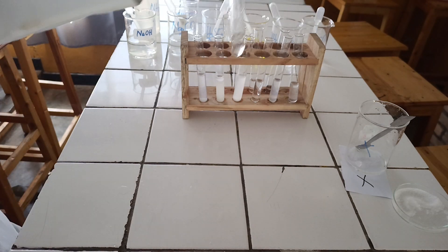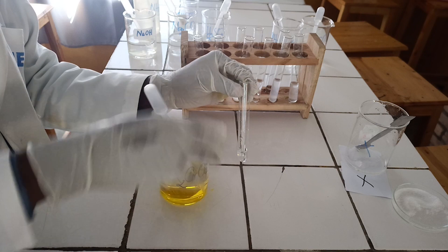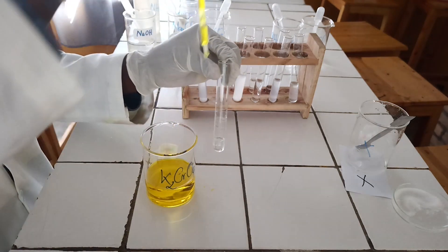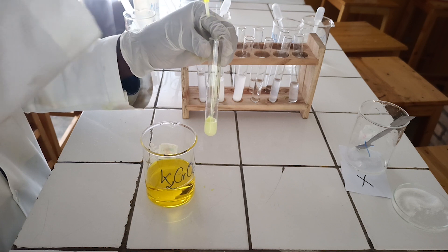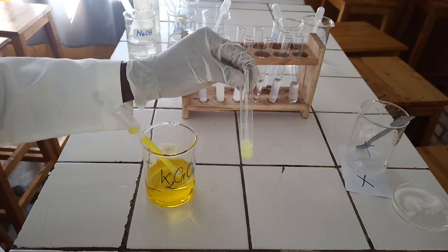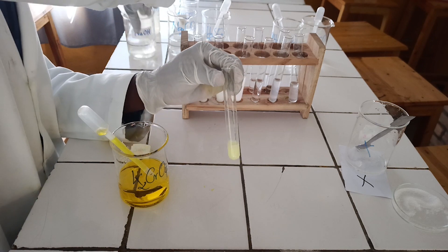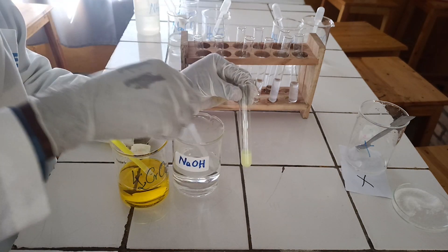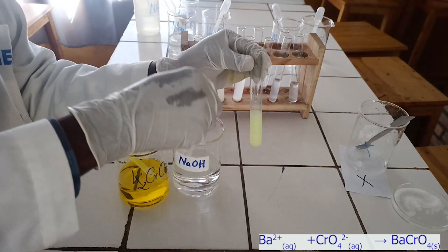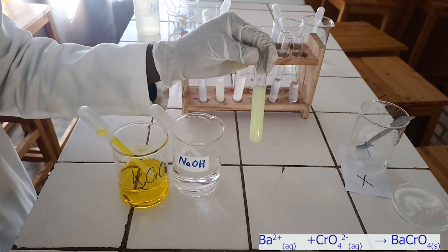Second confirmatory test. To the seventh test tube, add a few drops of potassium chromate solution followed by sodium hydroxide solution. As you see, potassium chromate reacts with barium ion to form a yellow precipitate, which is insoluble in excess of sodium hydroxide solution. Below, there is the ionic equation for this reaction.